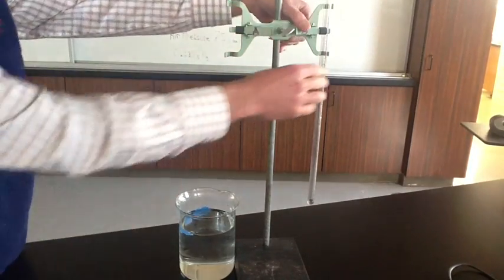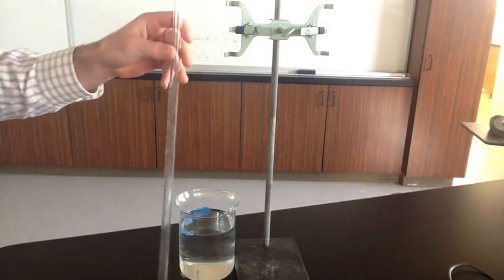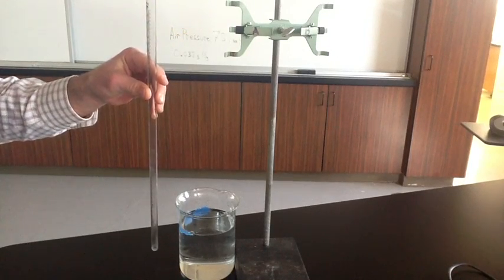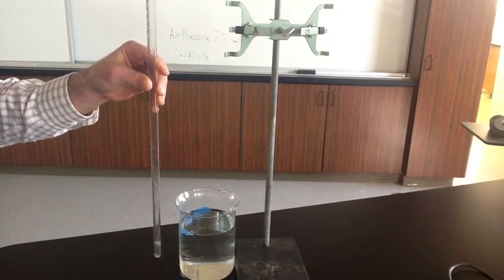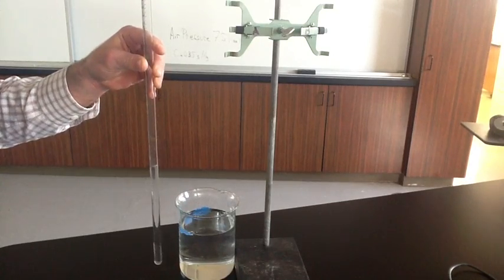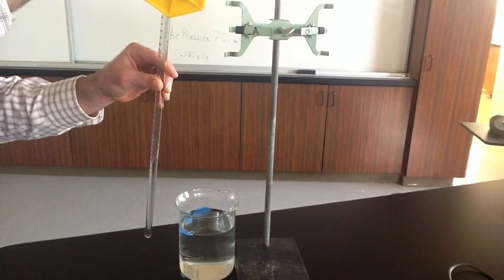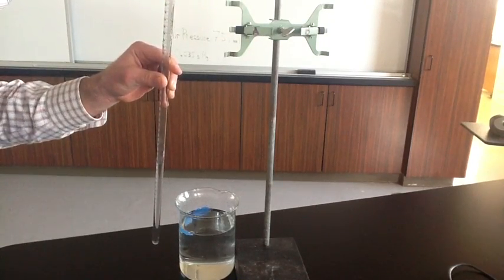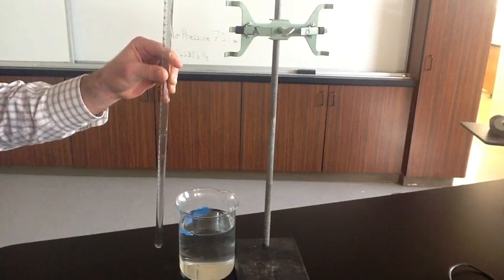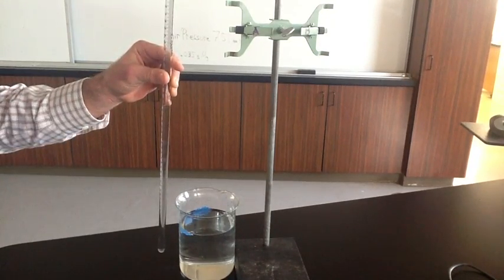We're going to collect the gas in this gas collection burette. So what we're going to do is add 20 milliliters of hydrochloric acid. So we'll put hydrochloric acid, 20 milliliters, into our gas collection burette. And then we'll fill the rest of the way with water. Hydrochloric acid has a higher density than water, so it's going to remain at the bottom of this burette, and the water will, for the most part, sit on top of it. It won't mix very much.